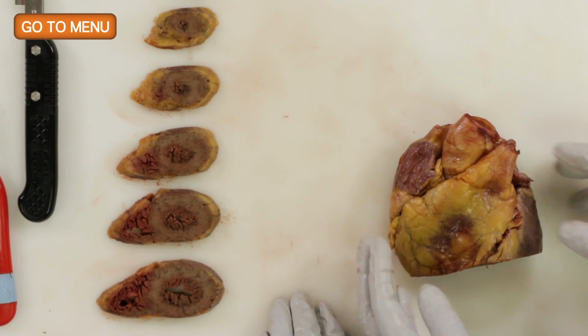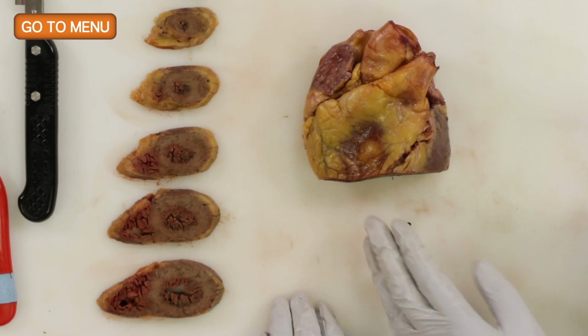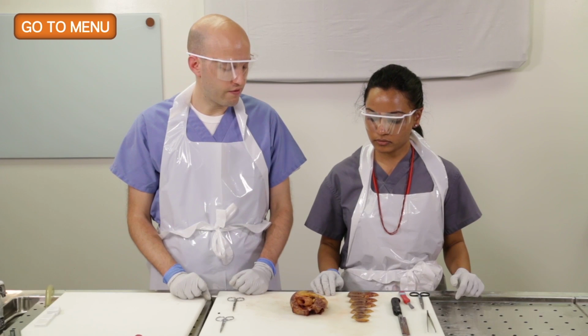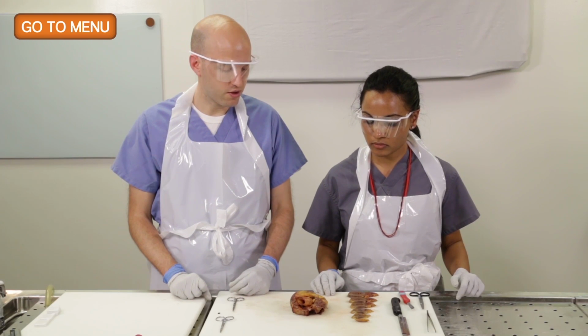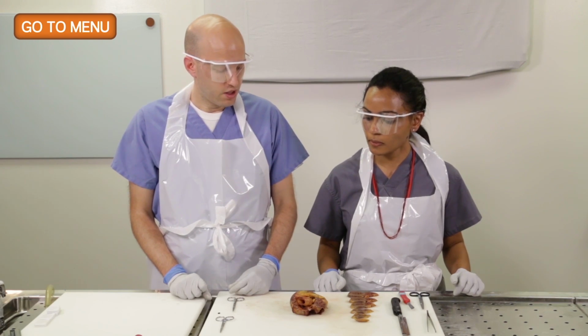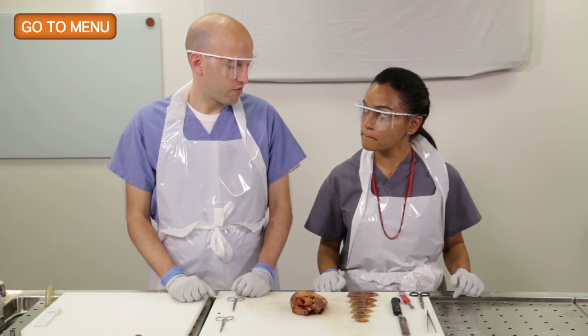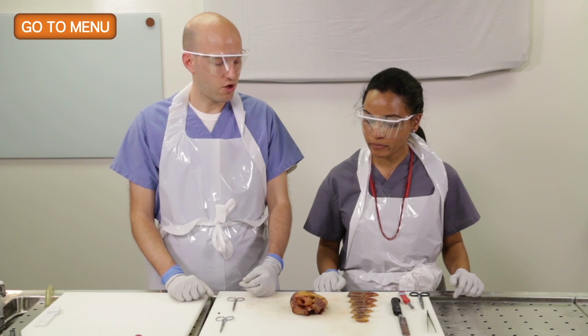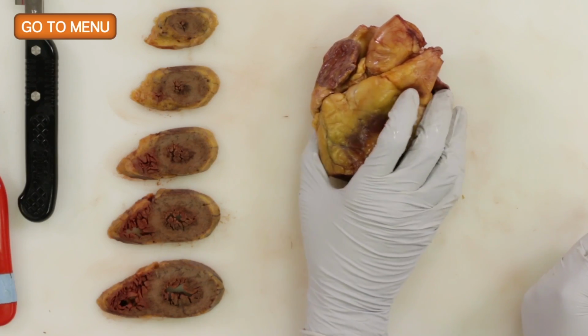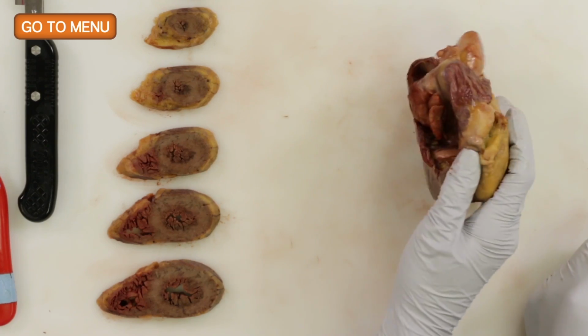Okay, so let's turn back to the base of the heart. And then we're going to, or you're going to cut so that we can see the valves and the remainder of the heart grossly. So the first thing that we're going to concentrate on is what we call the flow of blood. And so we want to start on the right side. So you want to identify the superior vena cava and inferior vena cava.